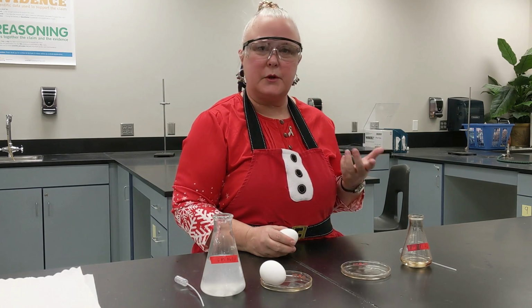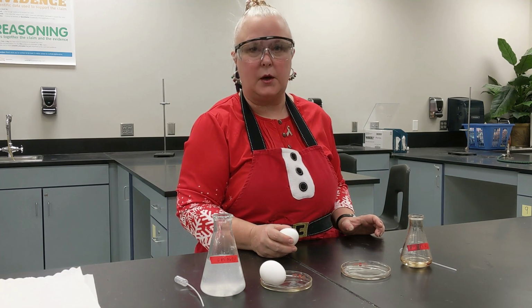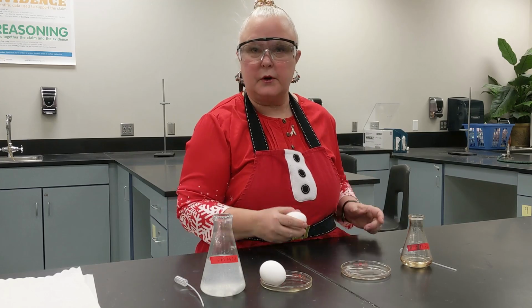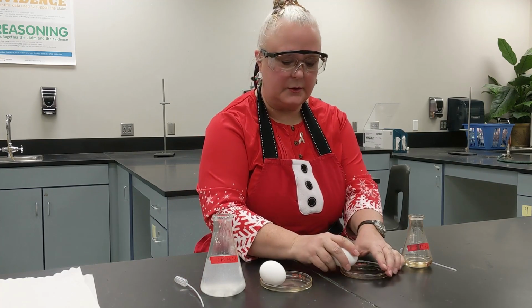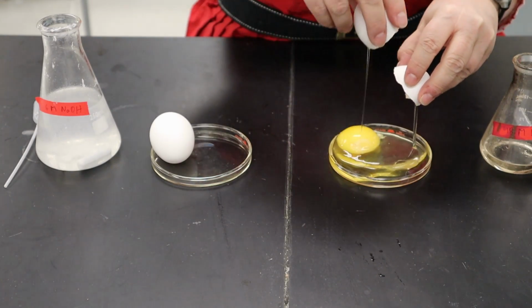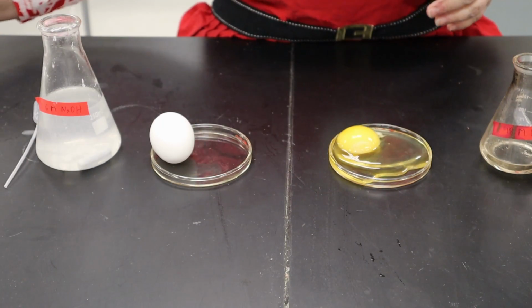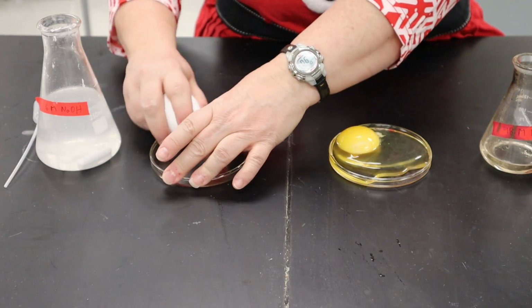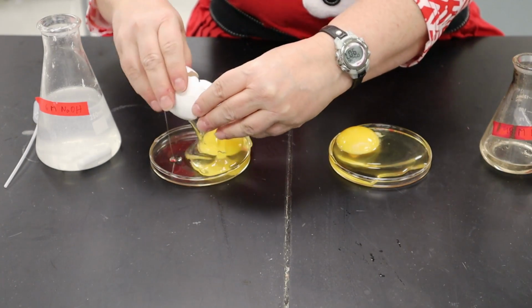So why do we need to wear goggles? This is one of these demonstrations that is going to show us how we need to watch out for our eyes. Well, eggs quite often look like eyes to us. We're going to crack an egg here. And you can see that the yellow looks a lot like the pupil of your eye. And the white looks a lot like the whites of your eyes.